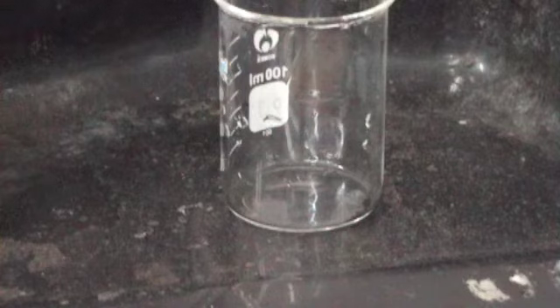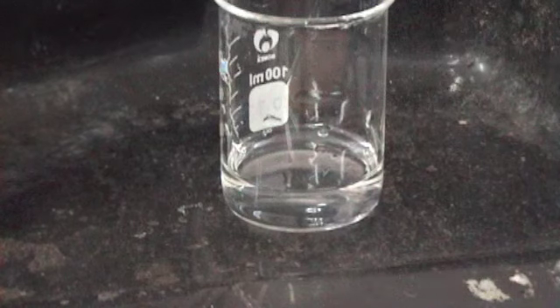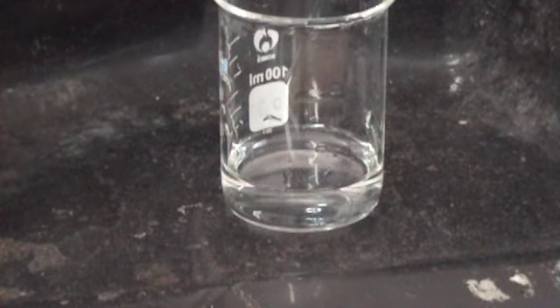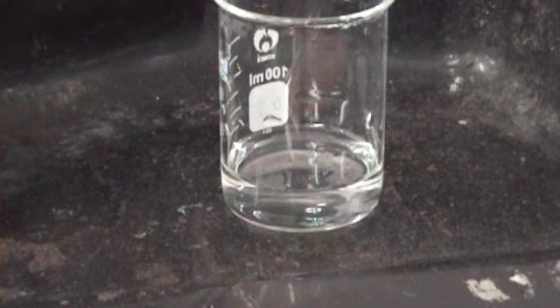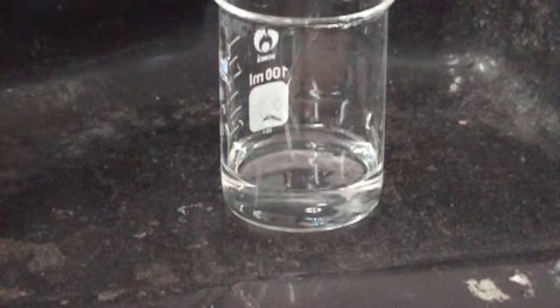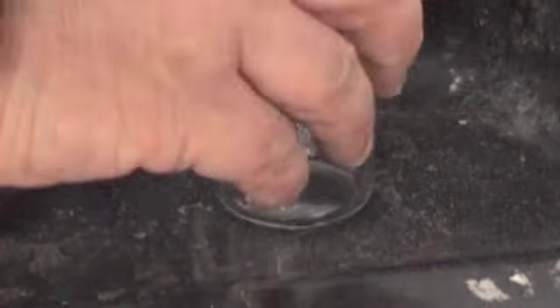Alright, so now we're looking for our anion, okay, so I put some more of our sodium iodide allegedly in here. Okay, first thing I'll do is put some litmus paper in. Okay, and okay, still pink, no change. So it's not hydroxide or carbonate, okay. So next thing is putting in barium. Alright, no change there, so it's not sulfate. Alright, so new sample.